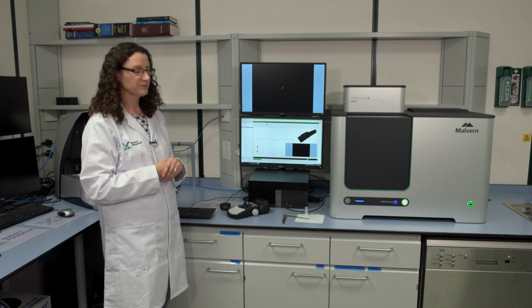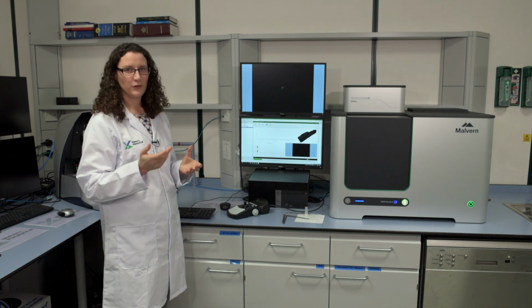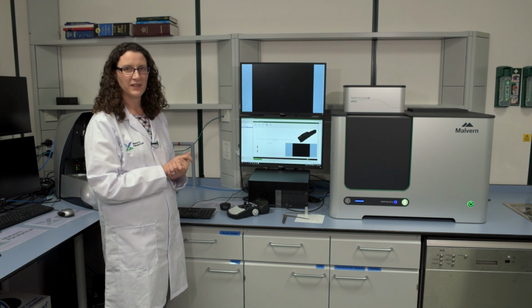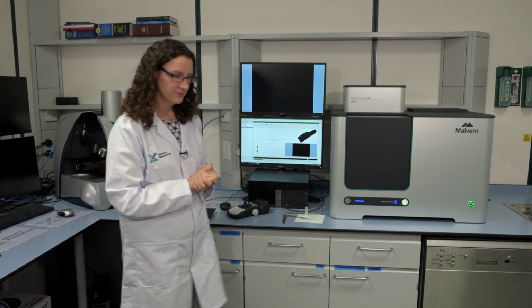I shall just leave you for a few minutes whilst it continues its initialization, and I'll come back and tell you more about the analysis once it's started again.